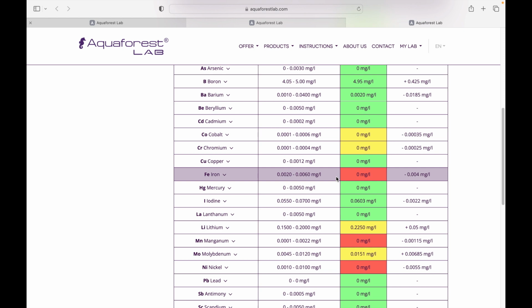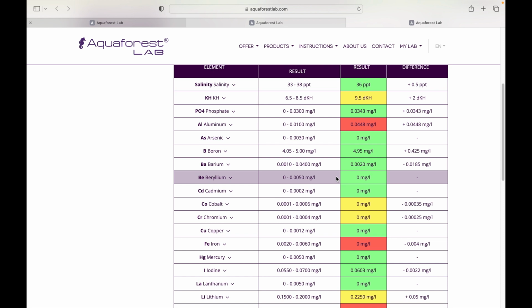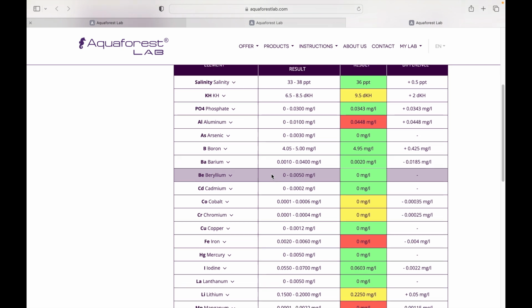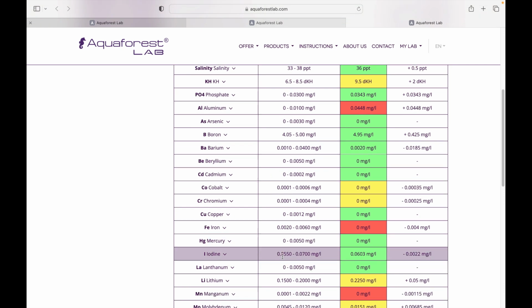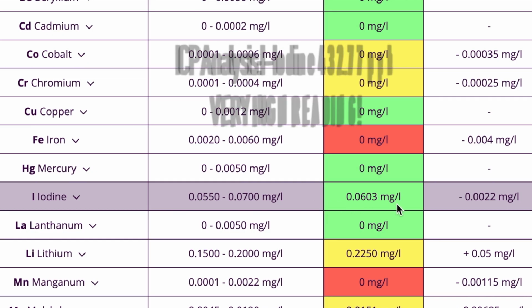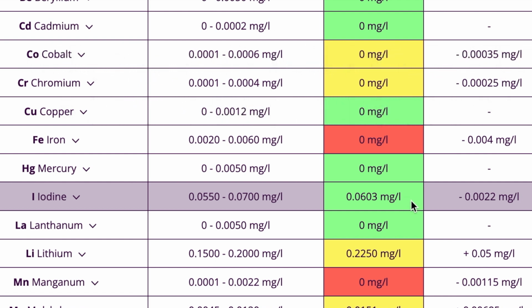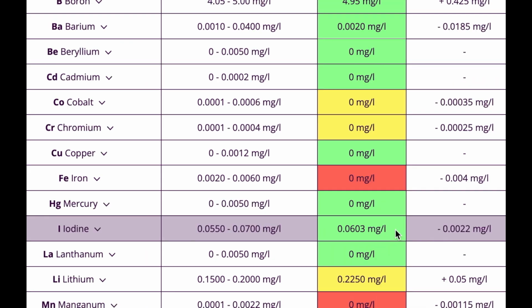Let's look here. If we go back, iodine was high. So let's find iodine here. Iodine, if you recall, the ICP Analysis test showed iodine as being extremely elevated, like way over limits, and it showed it in red. And yet this test here is showing it within limits, and that it's not a problem, which is concerning.